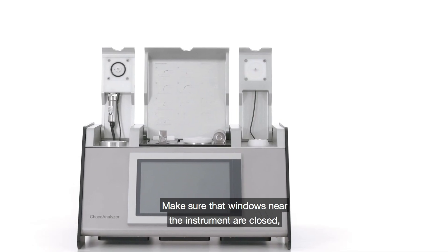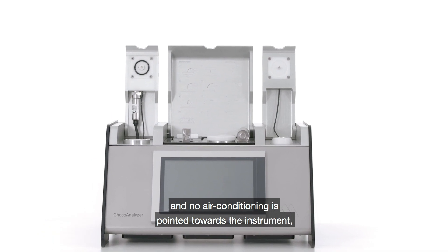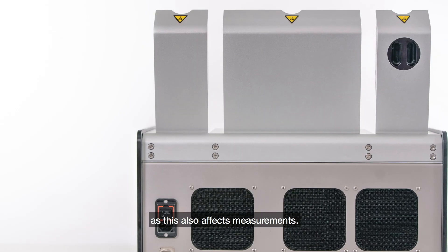Make sure that windows near the instrument are closed and no air conditioning is pointed towards the instrument as this also affects measurements.